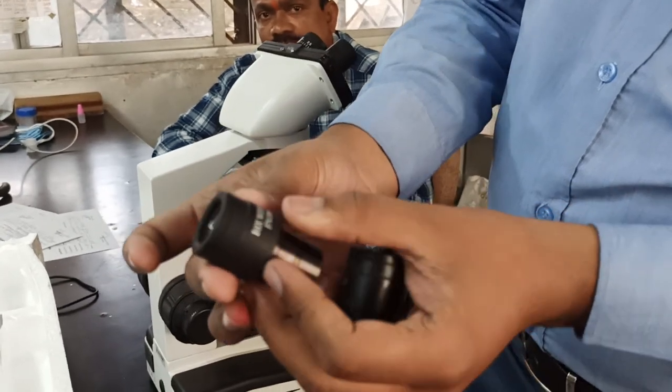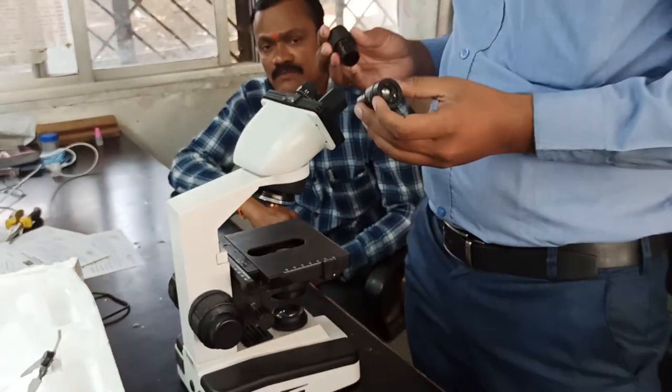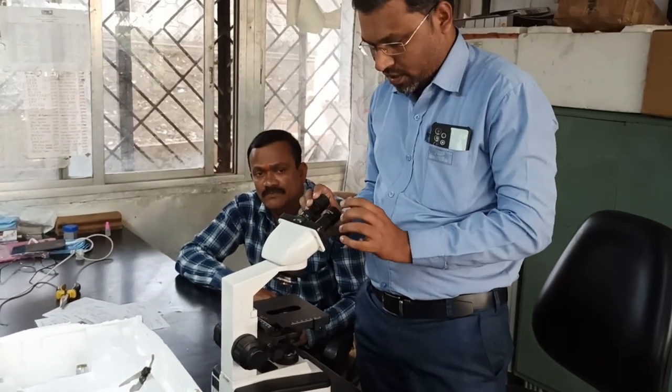These are the two lenses you can observe. See, this is nothing but a 10x wide field. This is also a 10x wide field. These are called eyepieces. You can put them like this.